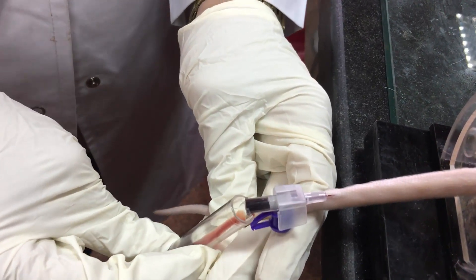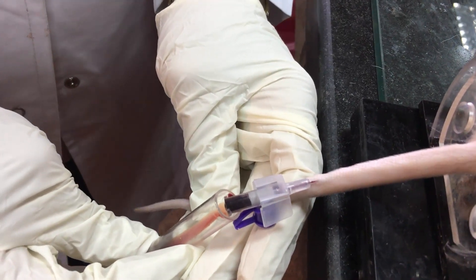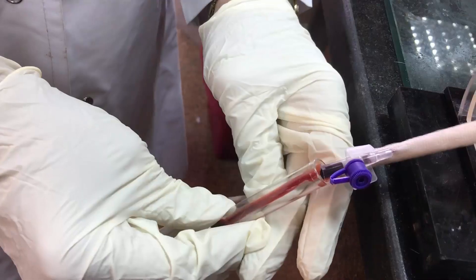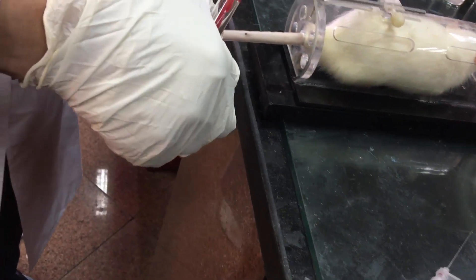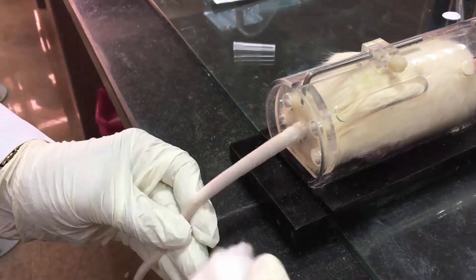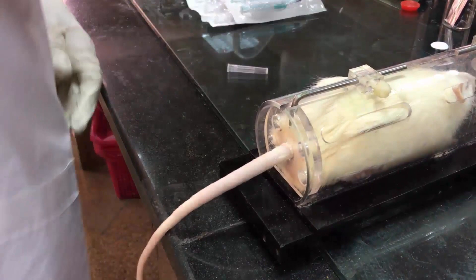So always move upward if you want to take multiple blood samples. After collecting the blood, remove the needle and apply gentle pressure to stop bleeding for at least 30 seconds before the animal is returned to its cage.